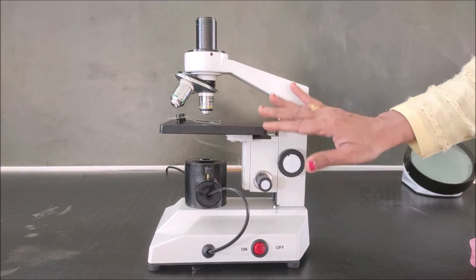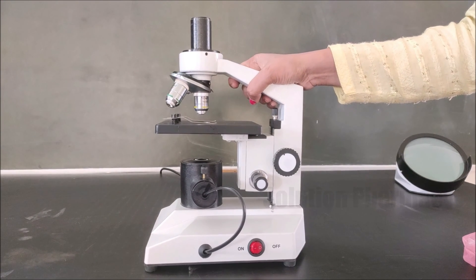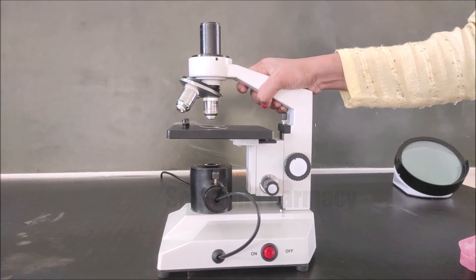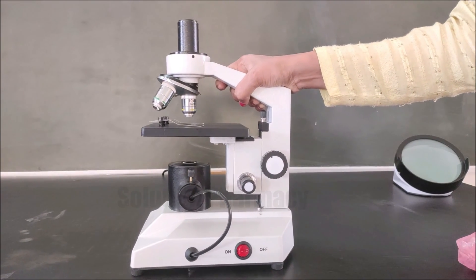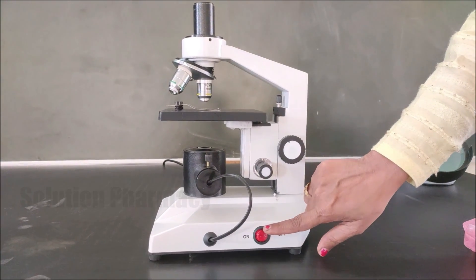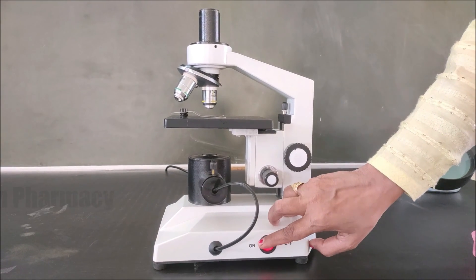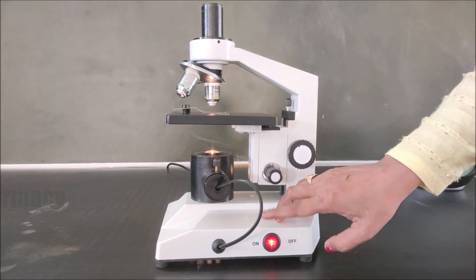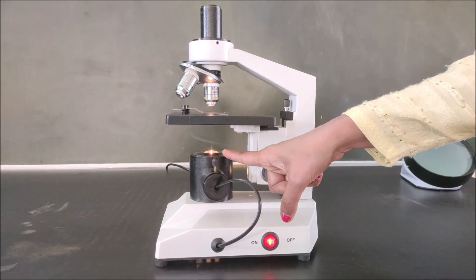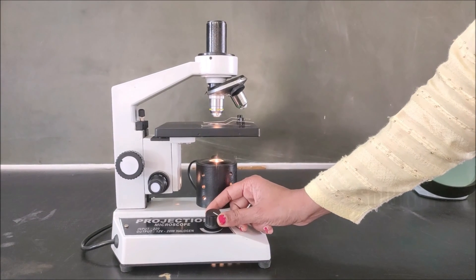This is the back side view of the microscope. This is the arm of the microscope, which supports the microscope body and connects it to the base. By holding this arm we can easily carry and move the microscope from one place to another. This is the on/off button — when we switch it on, light illuminates from the light source and focuses on the stage.